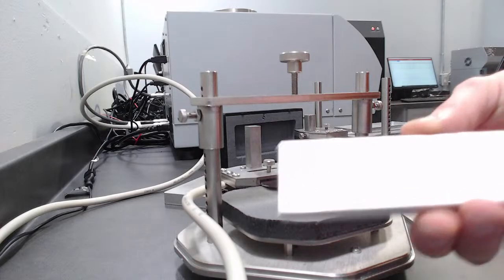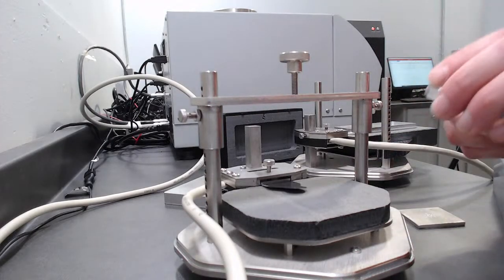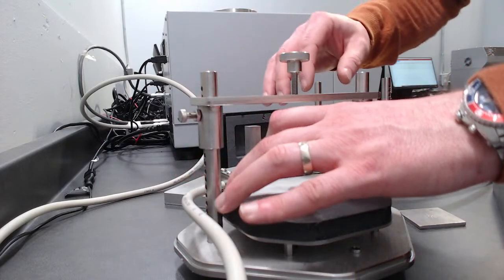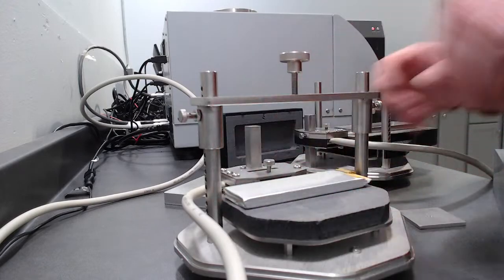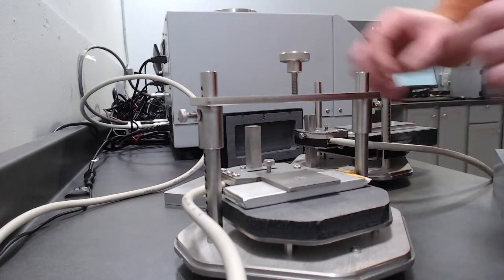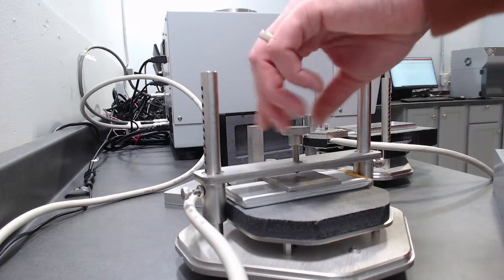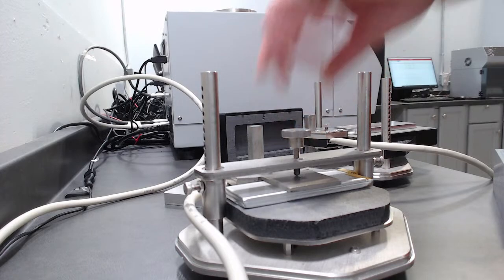So we're going to put the smooth side down on this sample, and we're going to center the sample to the sensor as best we can. And I've already recorded the thickness of this sample because we'll need that as an input for the setup. And then I'm going to put a protection plate on top so that I don't get any puncturing, because of course if you puncture the pouch, it will affect your results. You'll be letting out gas, especially if you're doing temperatures. And you only need thumb tight.